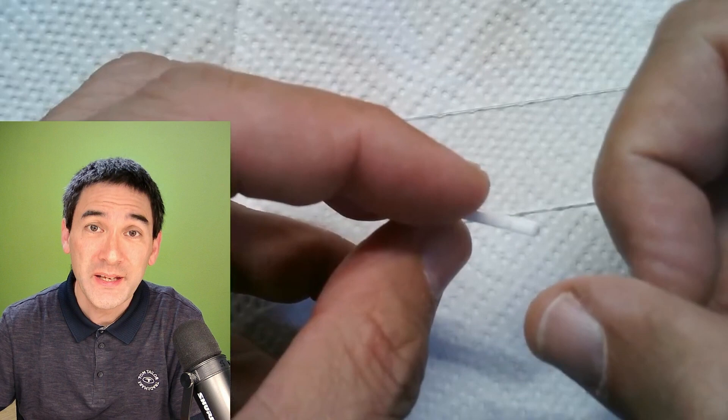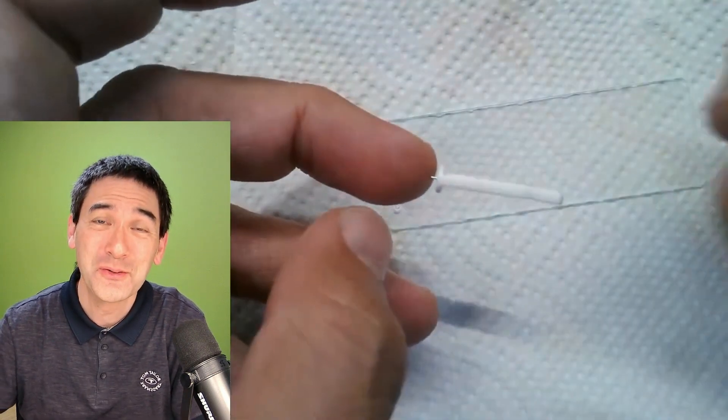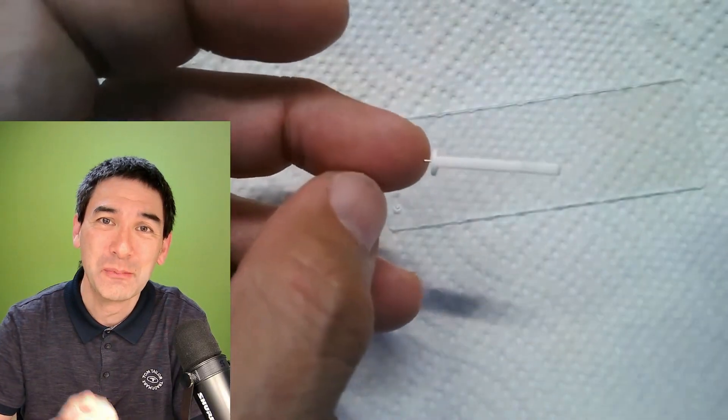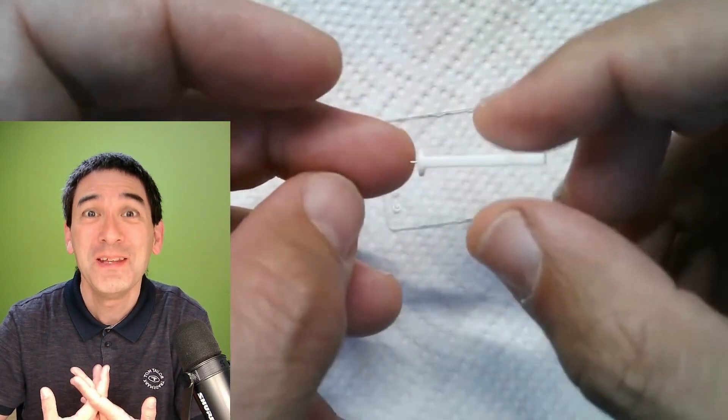There are different types available. This one is, I think, one of the more challenging ones because you can actually see when you actually prick yourself. There are also those pens available that are psychologically maybe a little bit easier to use.